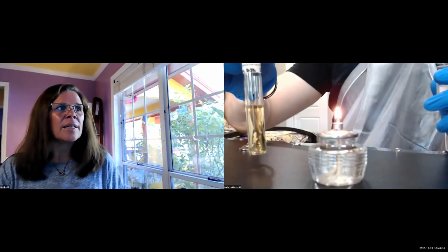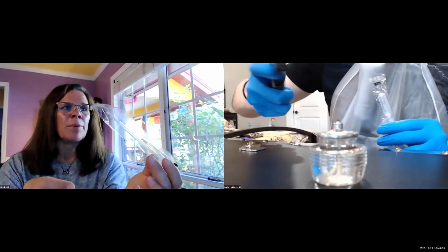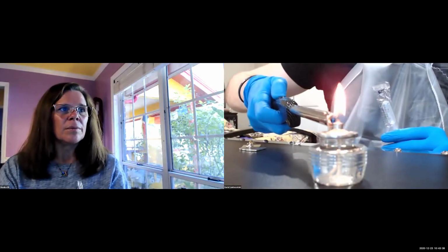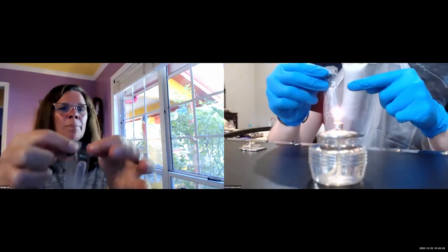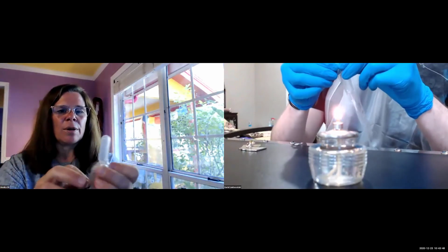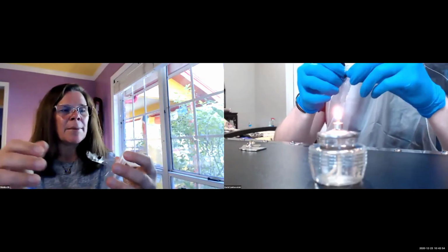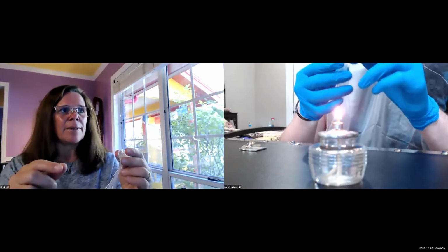The broth, correct? And your transfer pipette. One tip when you use your transfer pipette, never open it at the bottom because you want to keep it sterile. You always open it on the top part where the bulb is, and you don't want to touch anything below. You pull it out and then it's sterile. But at the same time keep it like this, and then have your liquid broth and flame it.